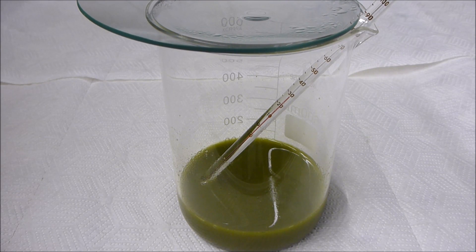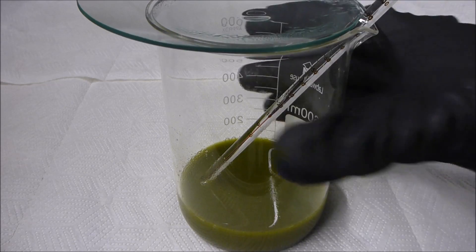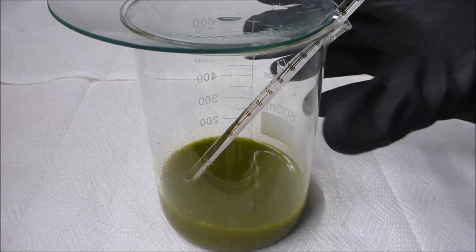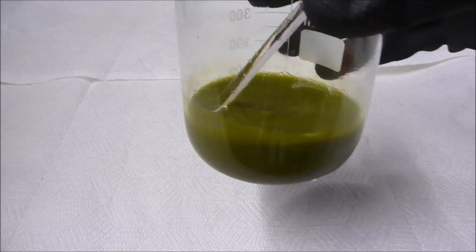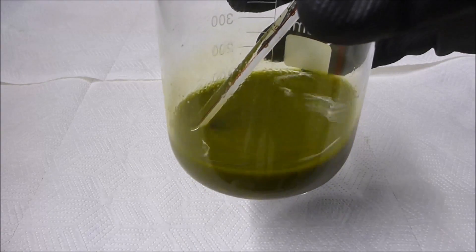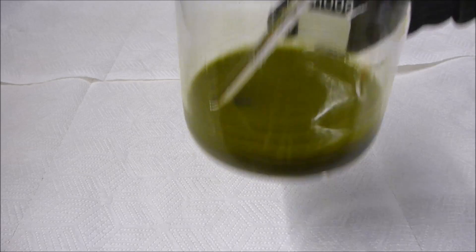Let's get this underway. We've got about 100 milliliters of a really terribly dirty solution that should contain about three or four grams of gold. That is quite a large volume for three or four grams.